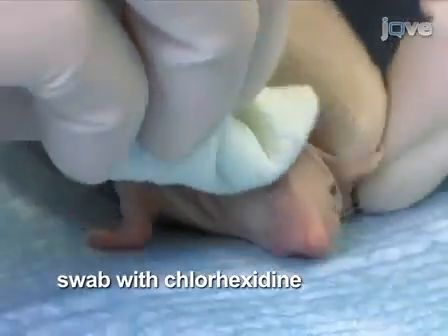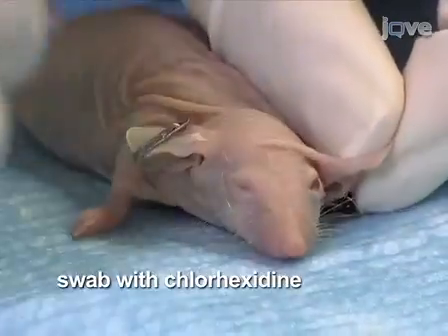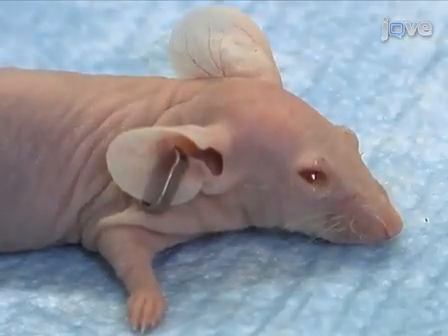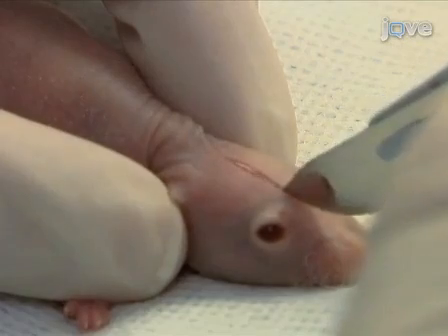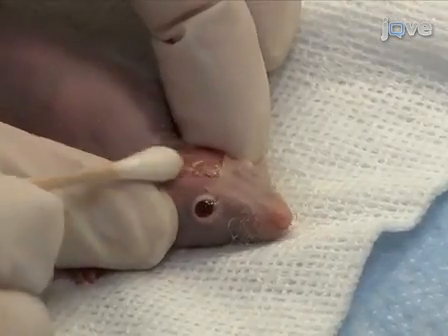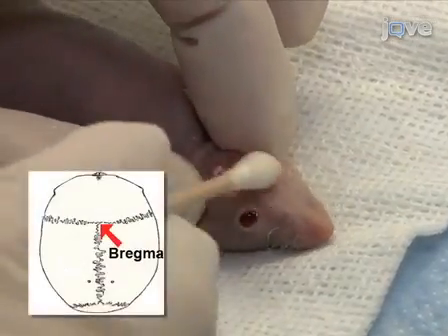Once the mouse has been anesthetized with a ketamine xylazine mixture, swab the surgical area several times using sterile gauze dipped in chlorhexidine. Apply eye ointment to maintain adequate moisture during the procedure. Using a sterile scalpel, complete a sagittal incision over the parieto-occipital bone, approximately 1 cm long. Using a cotton swab soaked in 3% hydrogen peroxide solution, clean up the exposed skull surface. The bregma should be apparent at this point.